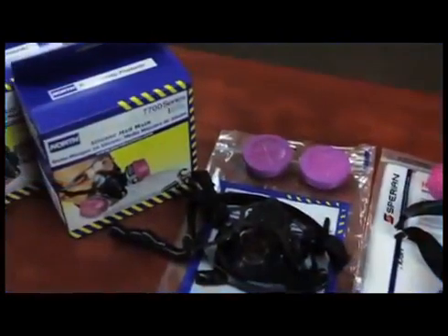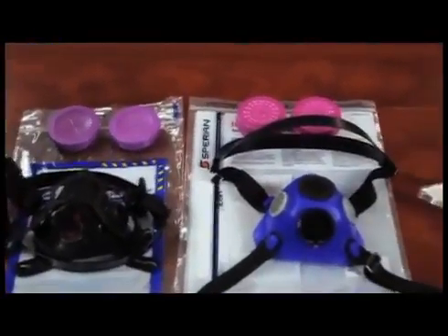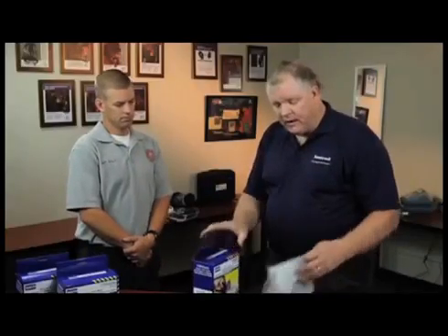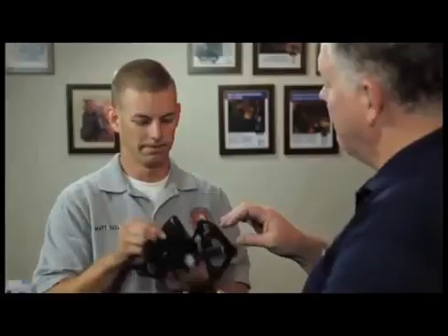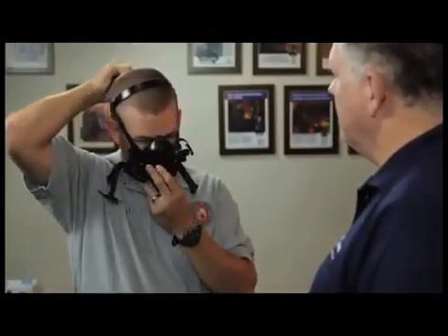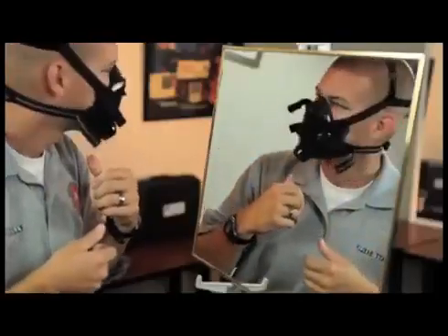First, allow the subject to select a respirator from a sufficient number of models so that the respirator is acceptable to the user and fits correctly. Let the subject know that each respirator represents a different size and shape, and if fitted and used properly, will provide adequate protection. If the subject is inexperienced in wearing a respirator, give instructions on positioning, setting strap tension, and determining an acceptable fit. Have a mirror available to aid in this process.